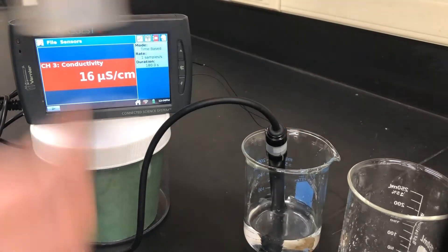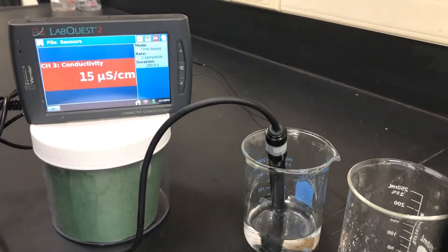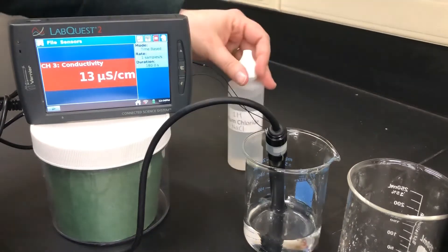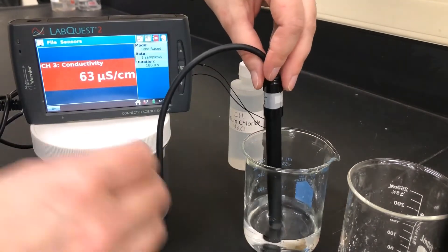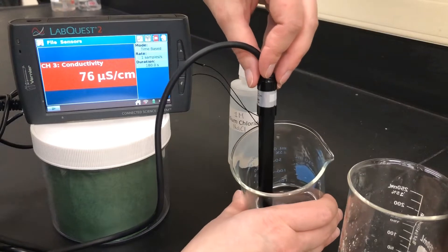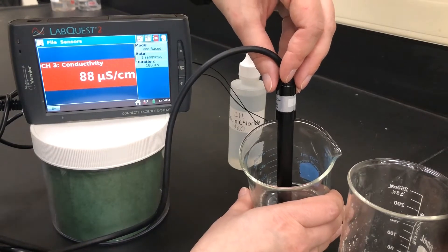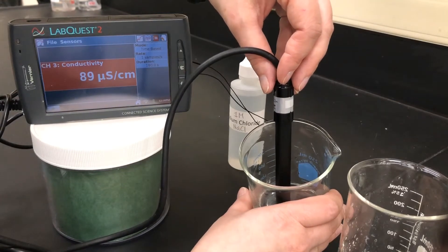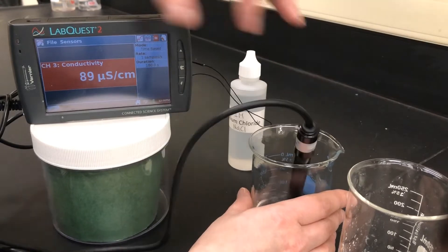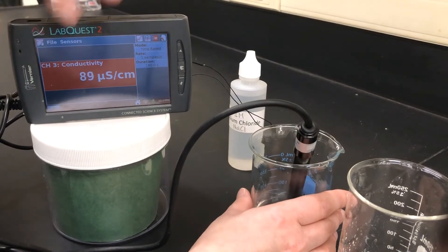I'm going to add one drop of sodium chloride to see how the conductivity changes. One drop — give this a swirl. Where this number stabilizes is what we will write down. Eighty-nine is our conductivity measurement for the first drop of sodium chloride.